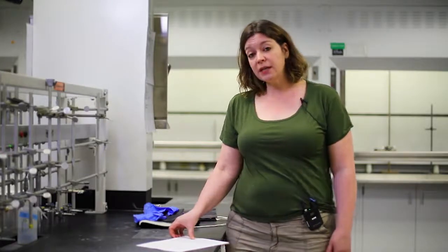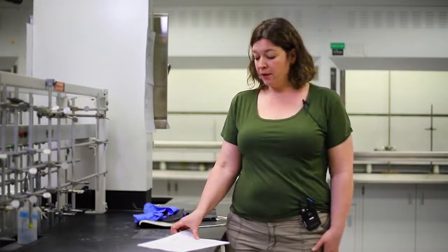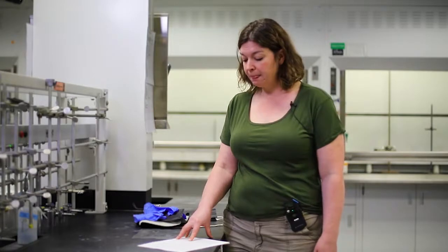We sometimes call this experiment the Unsafety Lab, and that's because we're going to show you some potentially hazardous properties of chemicals. And more importantly, we're going to show you how to keep yourself safe when you are doing lab experiments or laboratory activities. Chemistry is the study of matter and the interactions or reactions with other matter and energy. So this lab session is designed to introduce you to some of these properties and some of the potential hazards that you're going to see when handling materials.